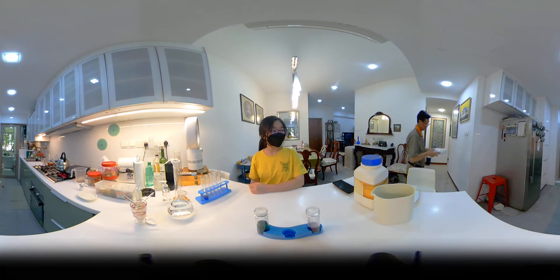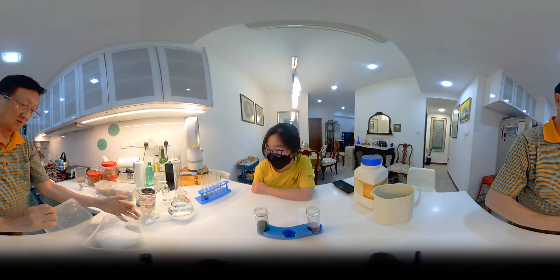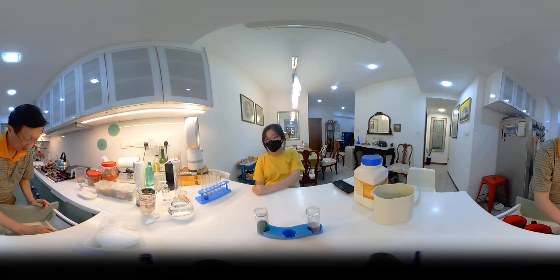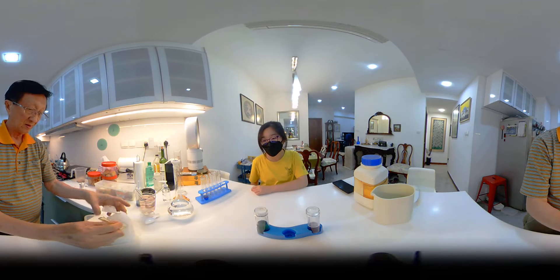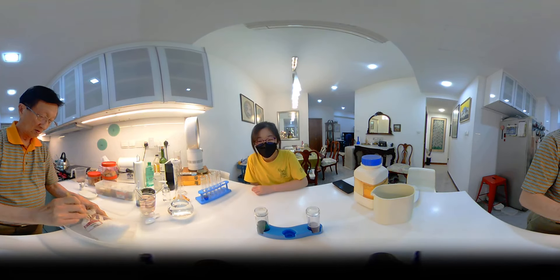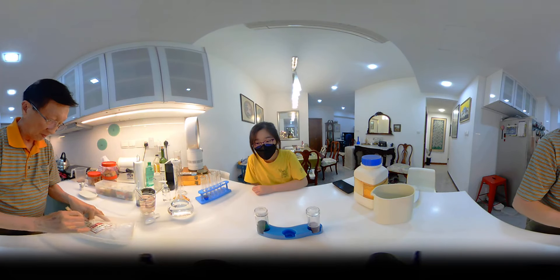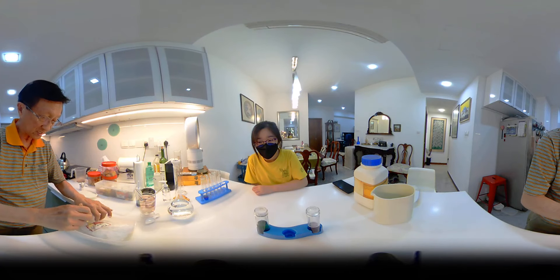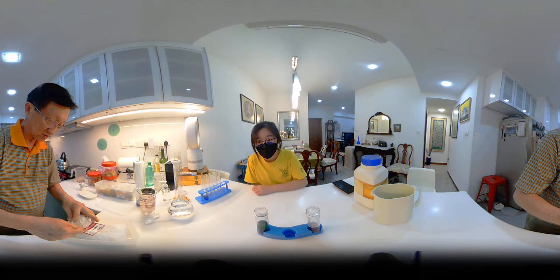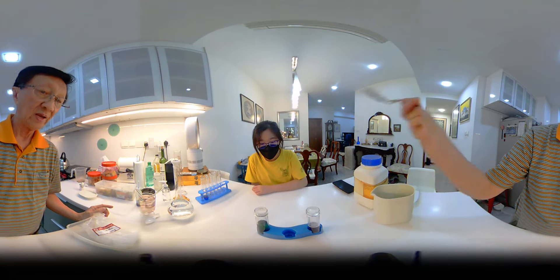Put in some sodium hydroxide solid. Sodium hydroxide solid is also known as caustic soda. So I put some caustic soda inside here, and I shake.